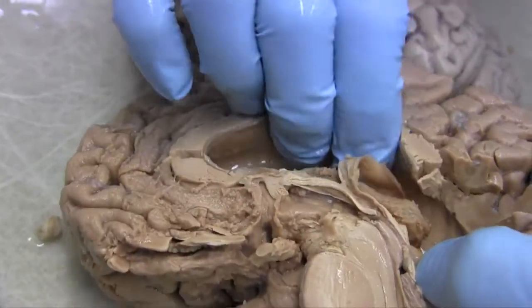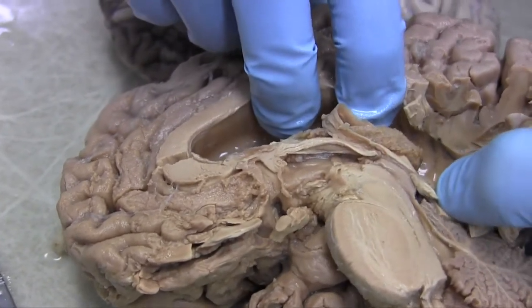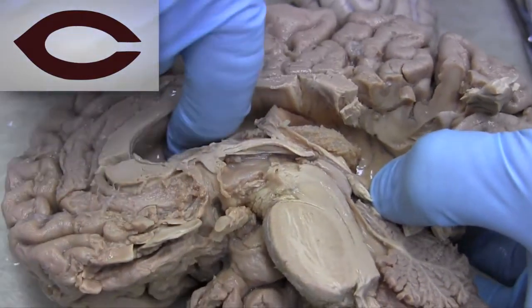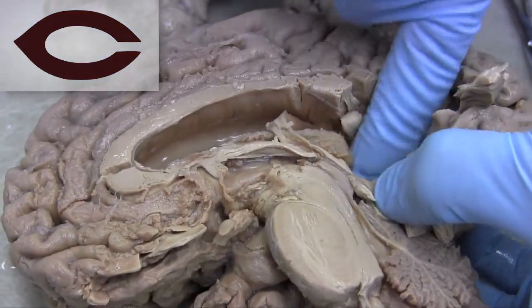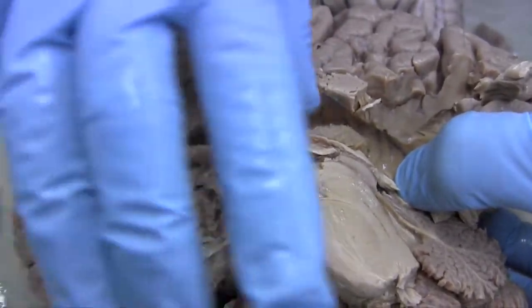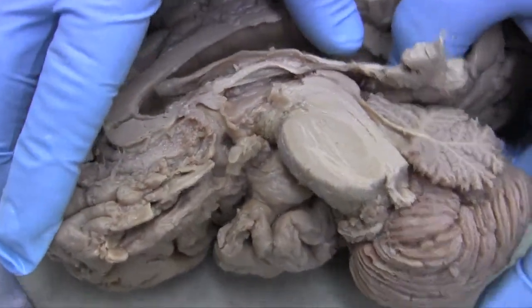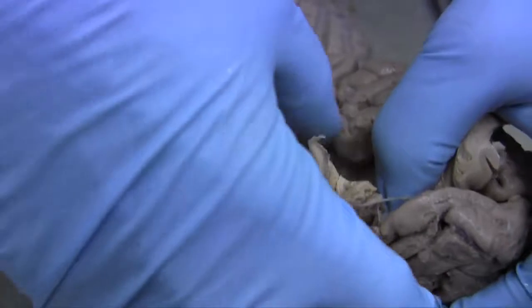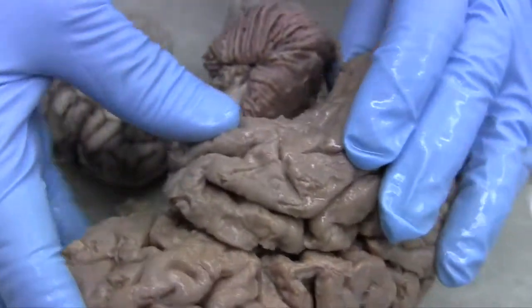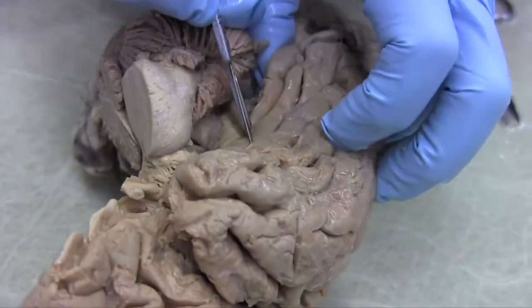Do you guys see this? This is the C. The brain is very University of Chicago, and it has a C, just like the University of Chicago logo. So it comes back here, it has a backward spur before going down to the bottom of the C. So it's a C off the midline a little. It's a C that goes around like a ram's horn. And so now let's try and follow it as it goes into the temporal lobe. And we're going to pick it up right here.